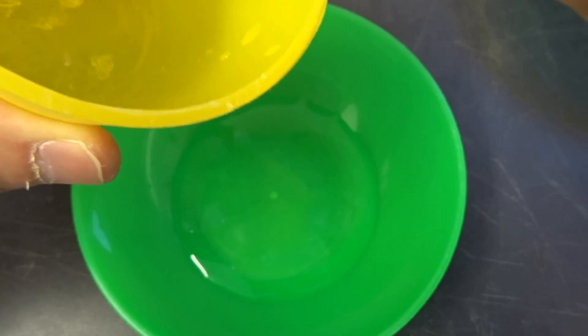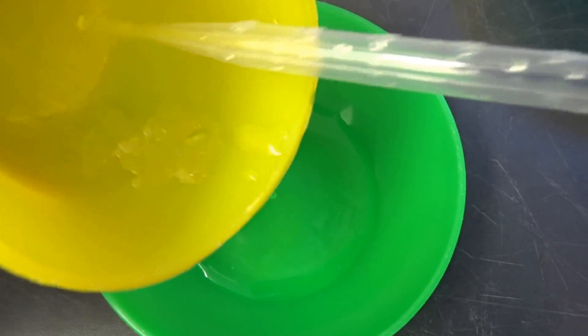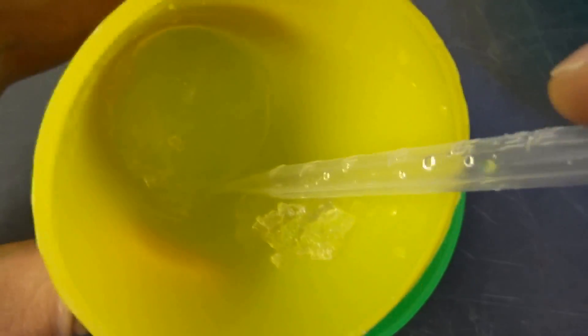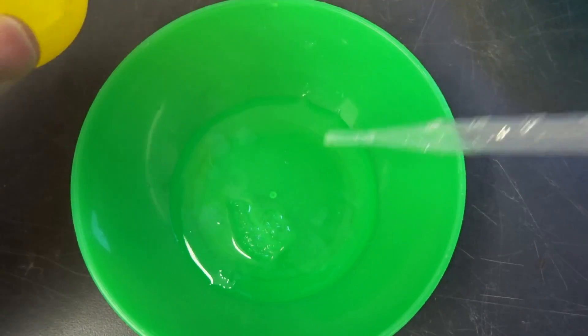So as you can see at the bottom there's also some stuff, and this is pretty hard, this is very unusual for these gels. So this is really some kind of crap, and the yellow probe didn't work at all. This is just junk.